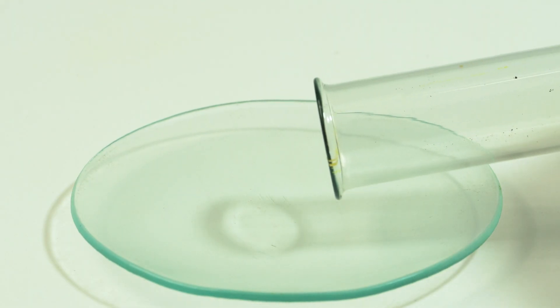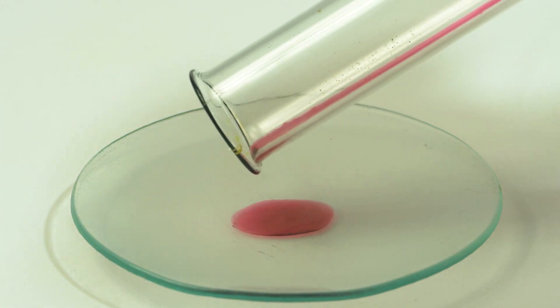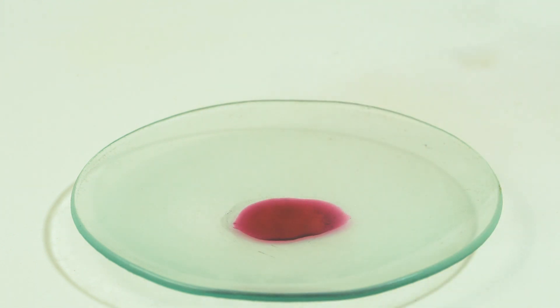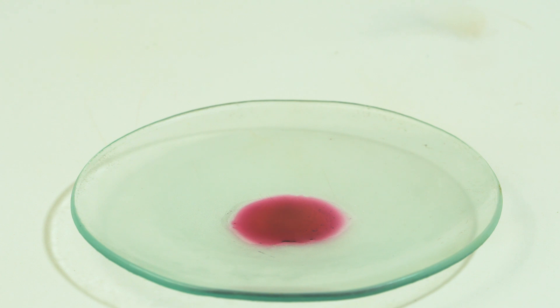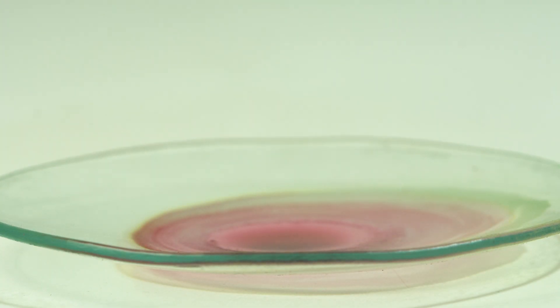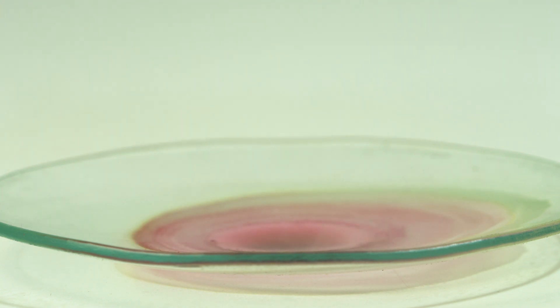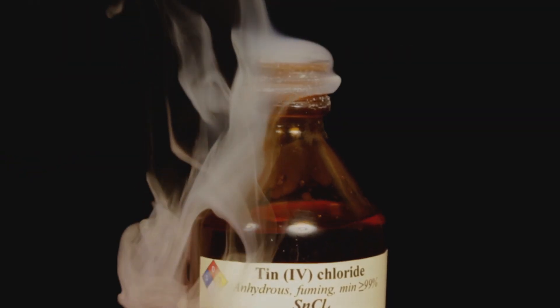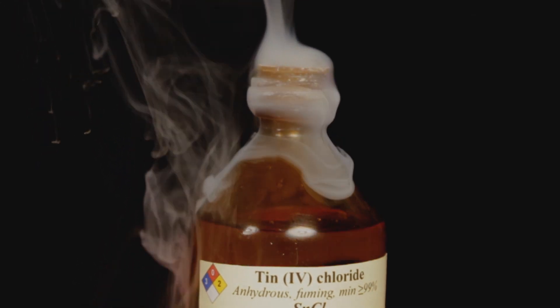The smoking liquid formed during the reaction is tin tetrachloride, polluted with iodine-containing reaction products apparently. By the way, check this out — it is pure tin tetrachloride. See how nicely its heavy vapors spread around the bottle walls.